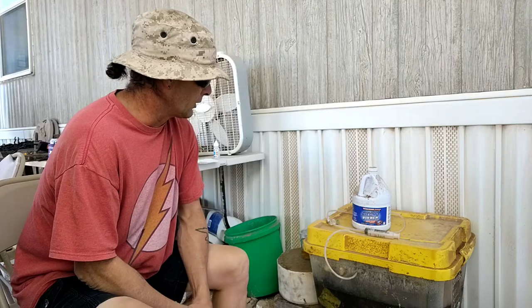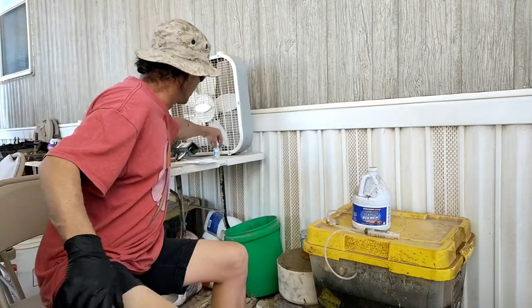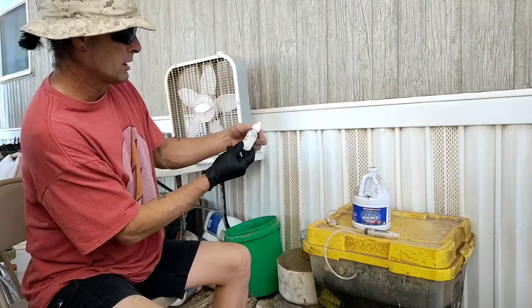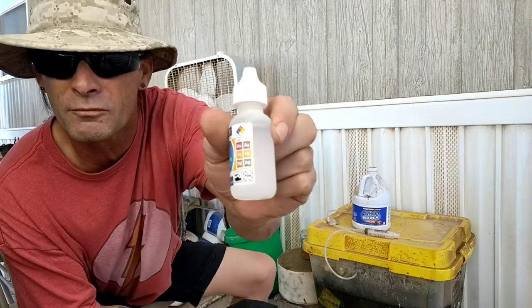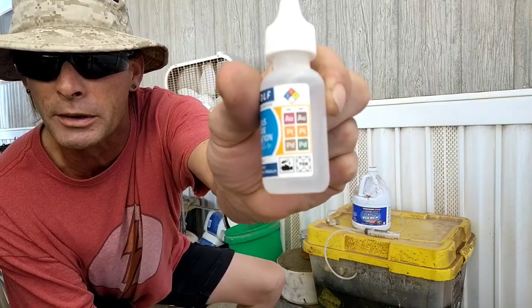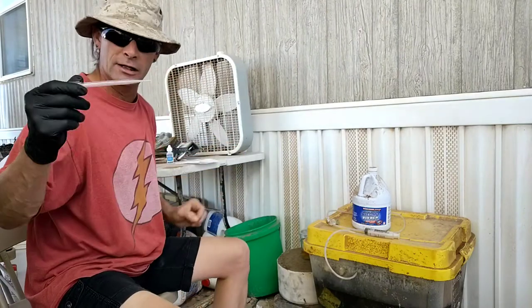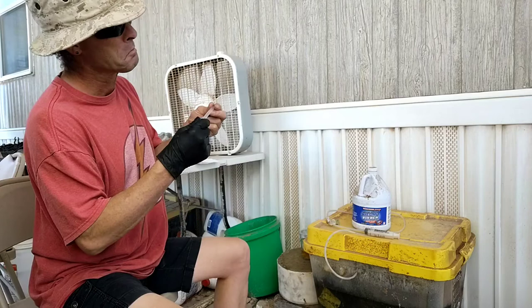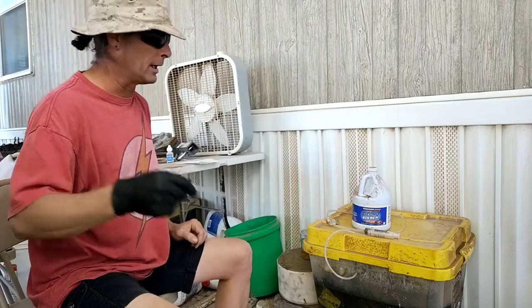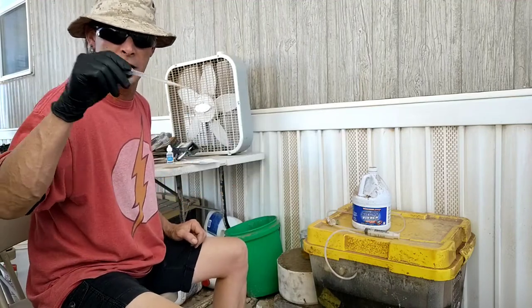What I'm going to do right now is show you guys a little bit of progress. What I have is a bottle of stannous chloride, which is a gold test solution. Different colors when you drop it on the acid — the different colors tell you what you've got. So first thing I'm going to do is take this pipette and reach into this one and get just a drop, a sample of the acid.